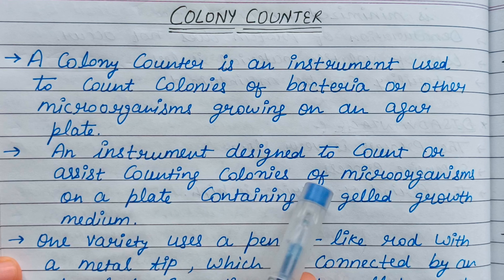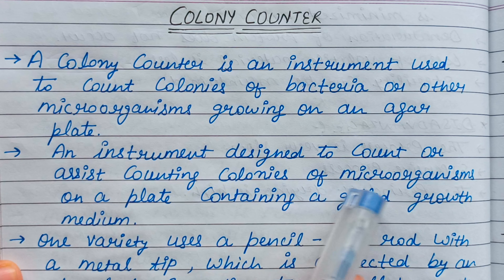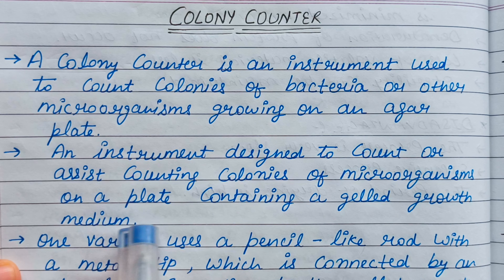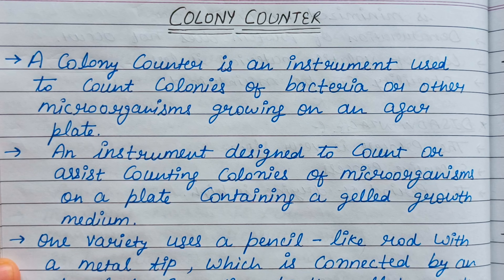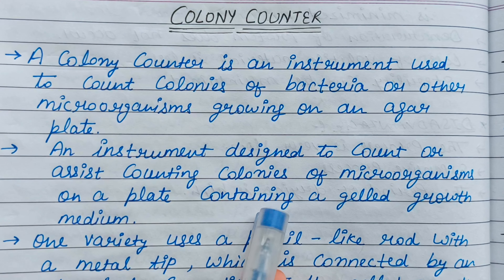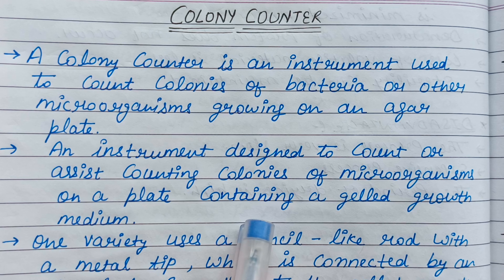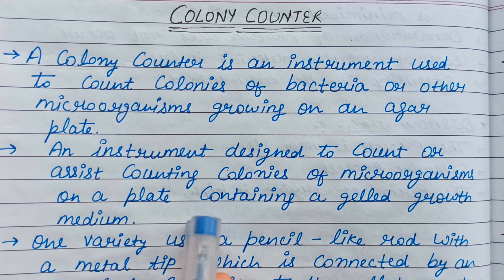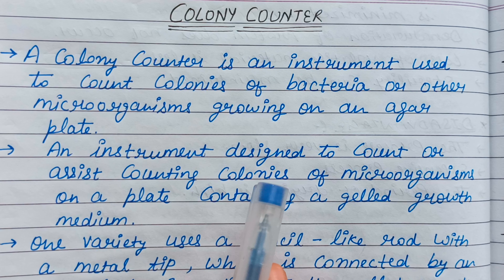It is an instrument designed to count or assist in counting colonies of microorganisms on a plate containing a gel growth medium. We grow colonies on the plate and count them using the colony counter.